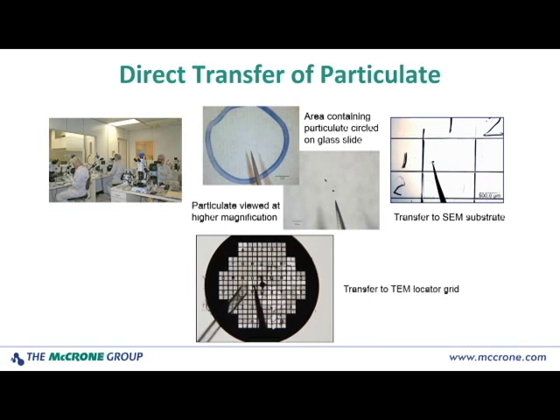And up at the top on the left, you see a picture of cleanroom microscopists at work in our ISO Class 5 cleanroom. They have combinations of polarizing light microscopes and stereoscopes for examining and isolating a variety of samples. In the center at the top, you see, in this case, a glass slide, but it could as well be a filter or some other type of substrate. A blue area has been circled, and there's particulate in the center of that circle that is of interest. At higher magnification, you see the end of a very fine tungsten needle, and the microscopist is using that needle to pick up that particulate, after which it's going to be transferred either to a scribed SEM substrate, as you see on the right, or at the bottom we see a TEM locator grid.